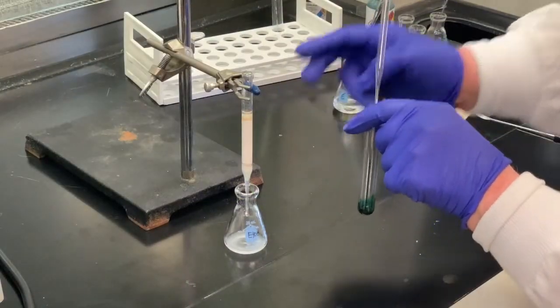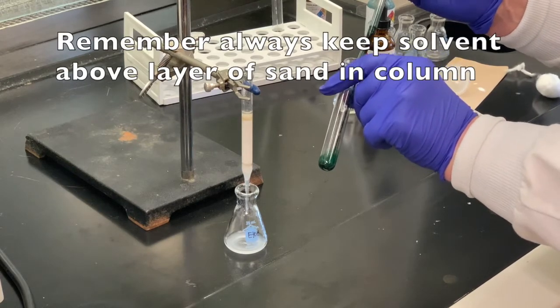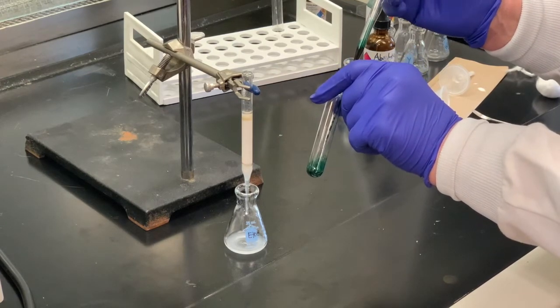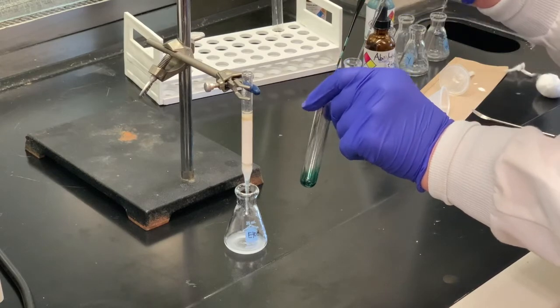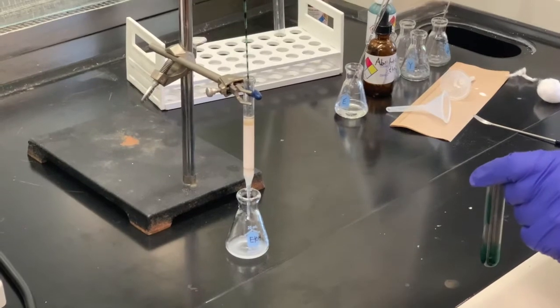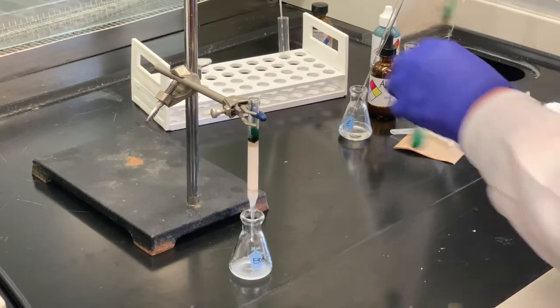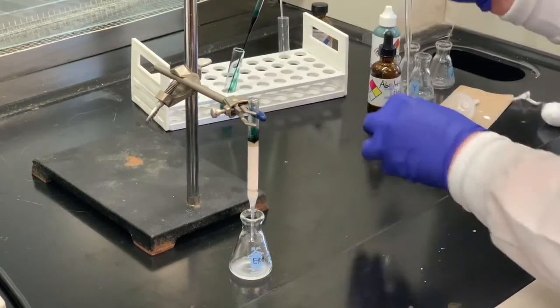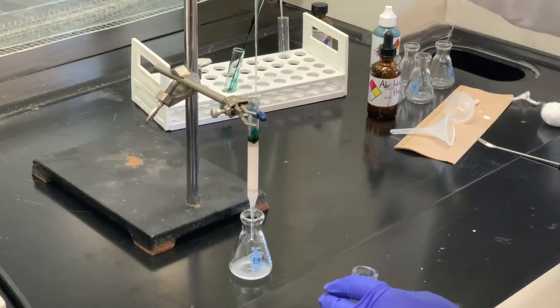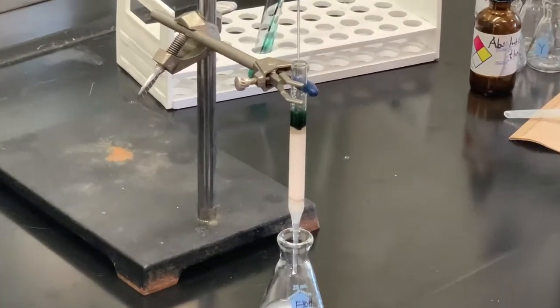The level of the solvent is just above the layer of the sand. I've got a mixture of the methylene blue and fluorescein. Methylene blue is a lot of times used in staining, and the fluorescein has also found some medicinal properties as well. I'm going to add a couple of drops and then rinse down the sides with the ethanol, because we want all of that to be going to the sand.